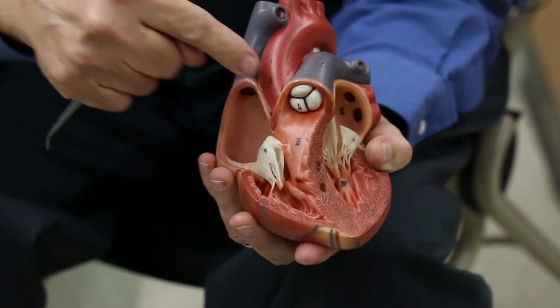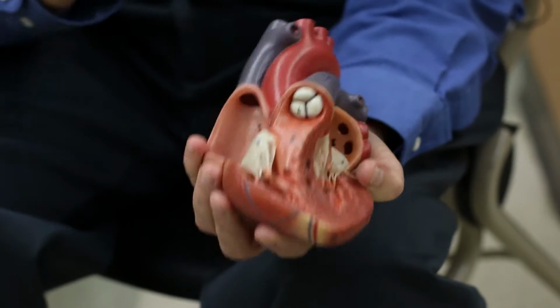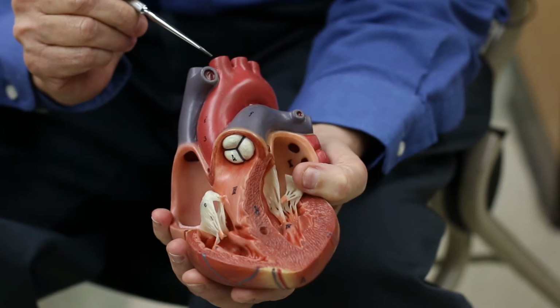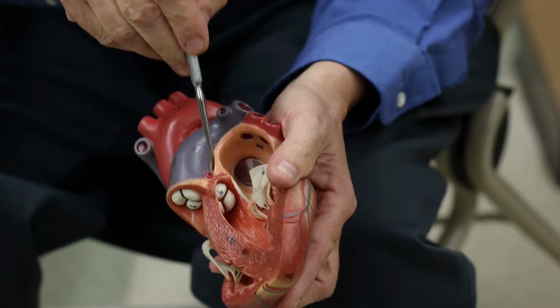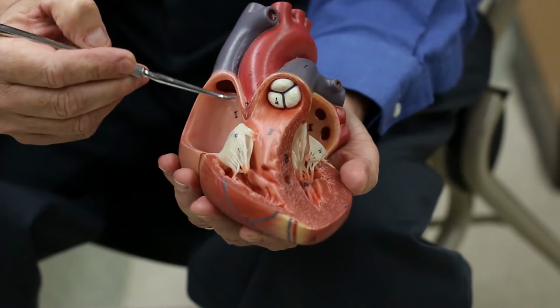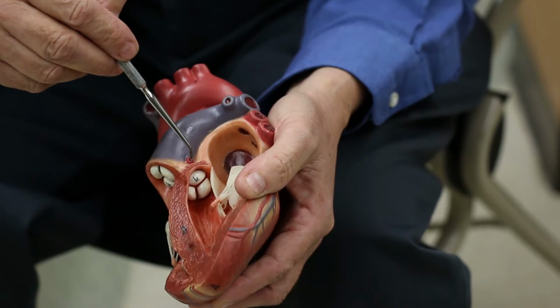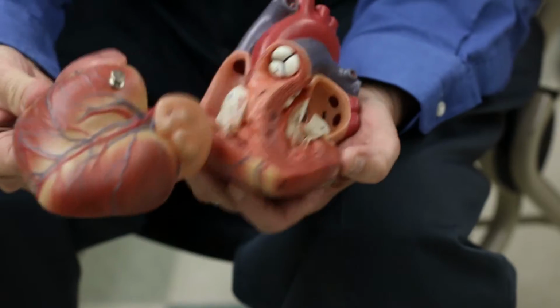On the aorta, right past these on the aortic side, there are two small blood vessels coming out, and we can see one of them here. It looks like it's coming out of here, but it actually doesn't. It comes from here. These are the coronary arteries. So we have the right coronary artery and the left coronary artery. We saw them on the model here when they were out on the surface.